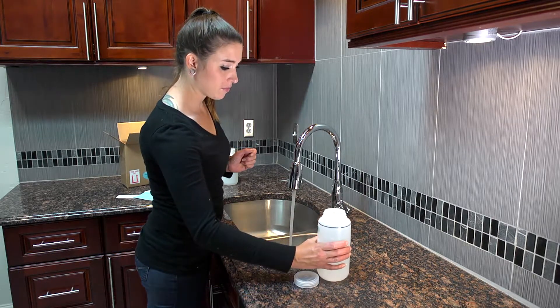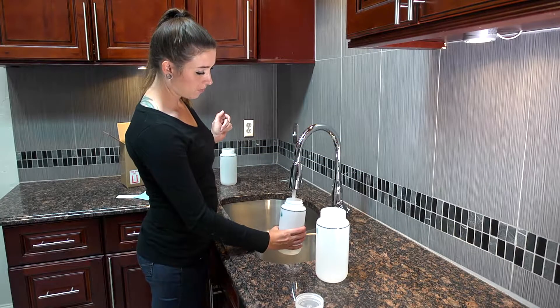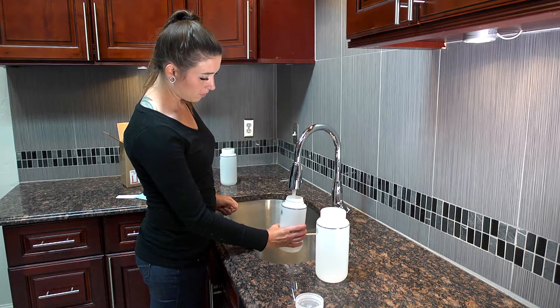Once filled, remove the bottle and let the water continue to flow another 25 seconds. Use bottle number two to collect the second sample following the same steps.